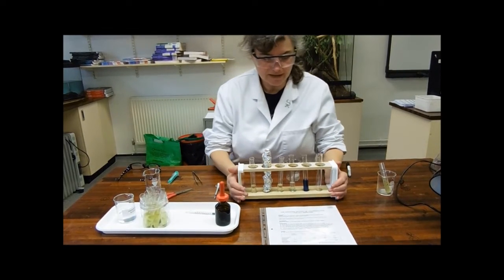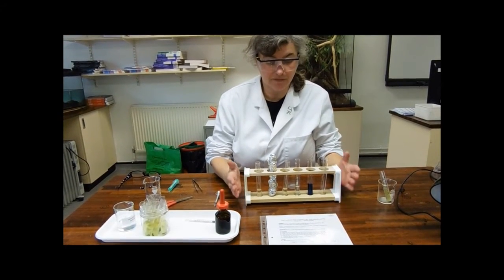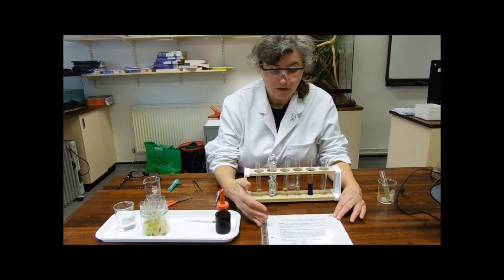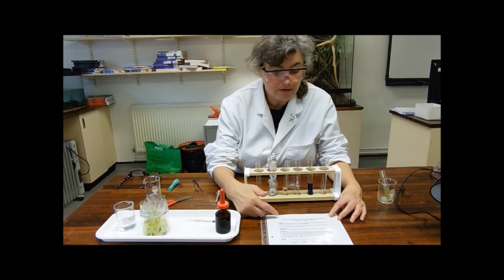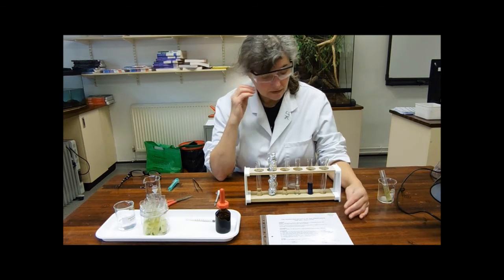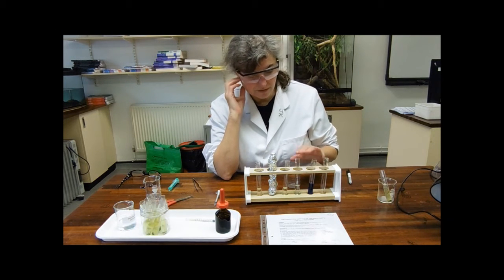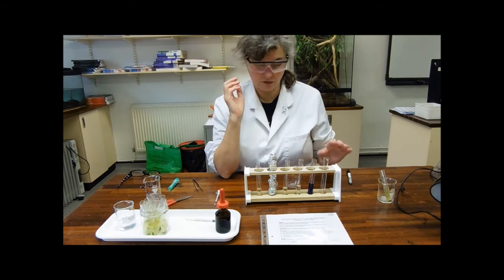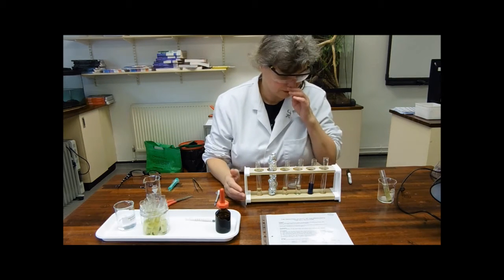OK, this experiment investigates the Hill reaction, which is about the reducing activity of chloroplasts. So I've set up tube one already because life's too short to be watching me setting up different tubes.